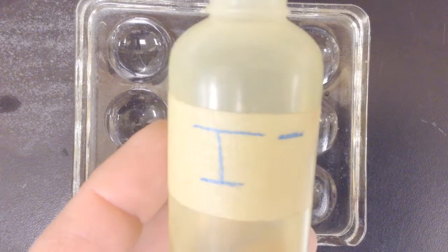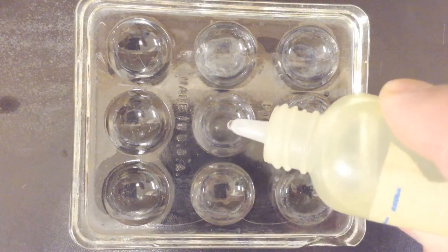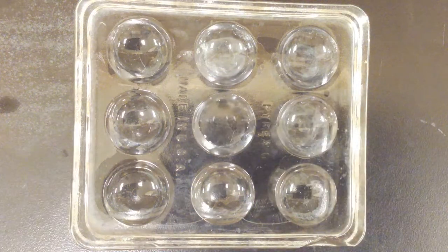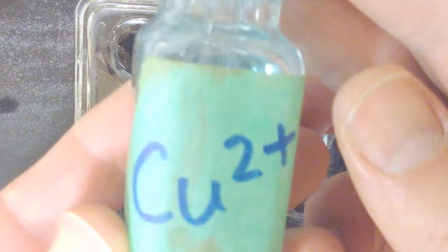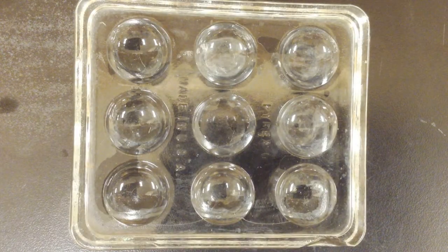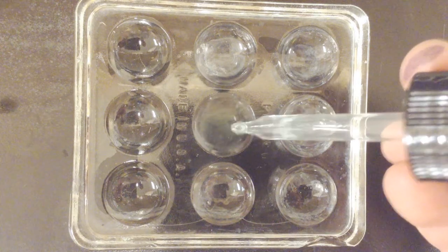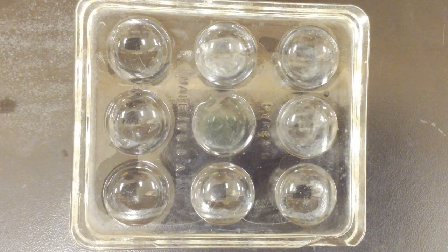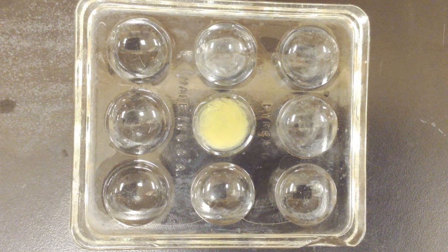So just because it looked like there was some contamination of the reaction plate, I'm going to take iodide ions, iodine 1-, put them in the middle well, and here I've got my copper 2+ as well. Let's give this one little test again, because that yellow is kind of weird. So you can see as we mix them, well, it's not. So you can see something here has happened, that we actually didn't have any contamination.